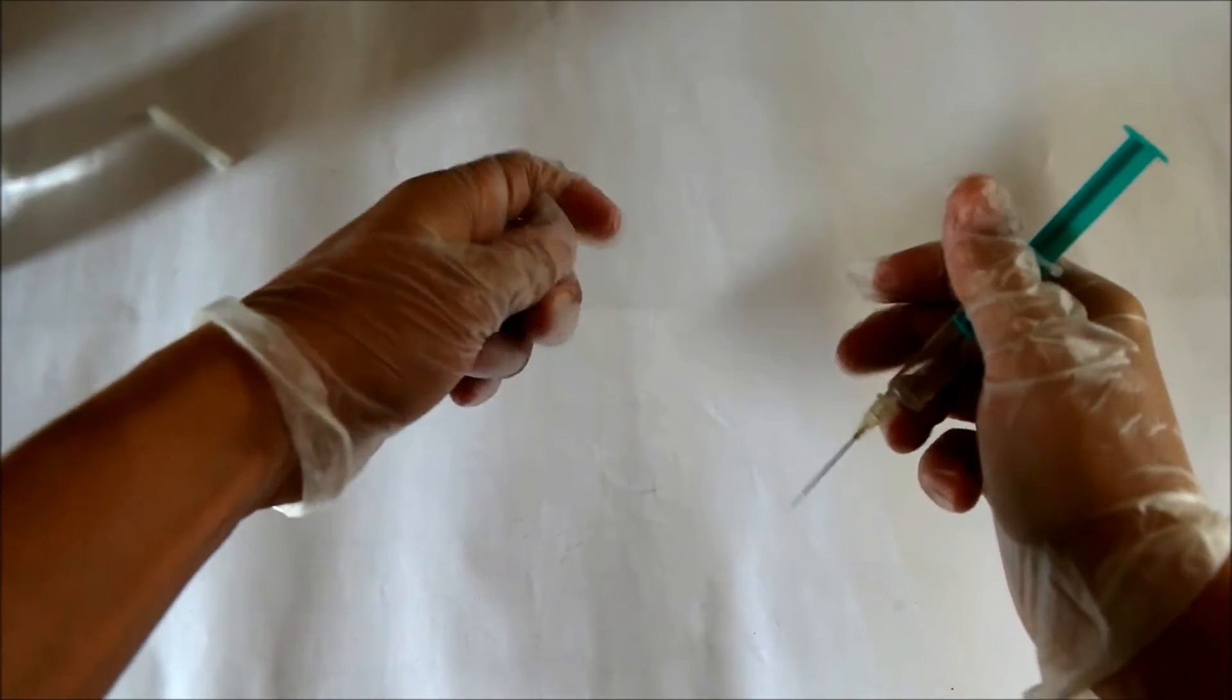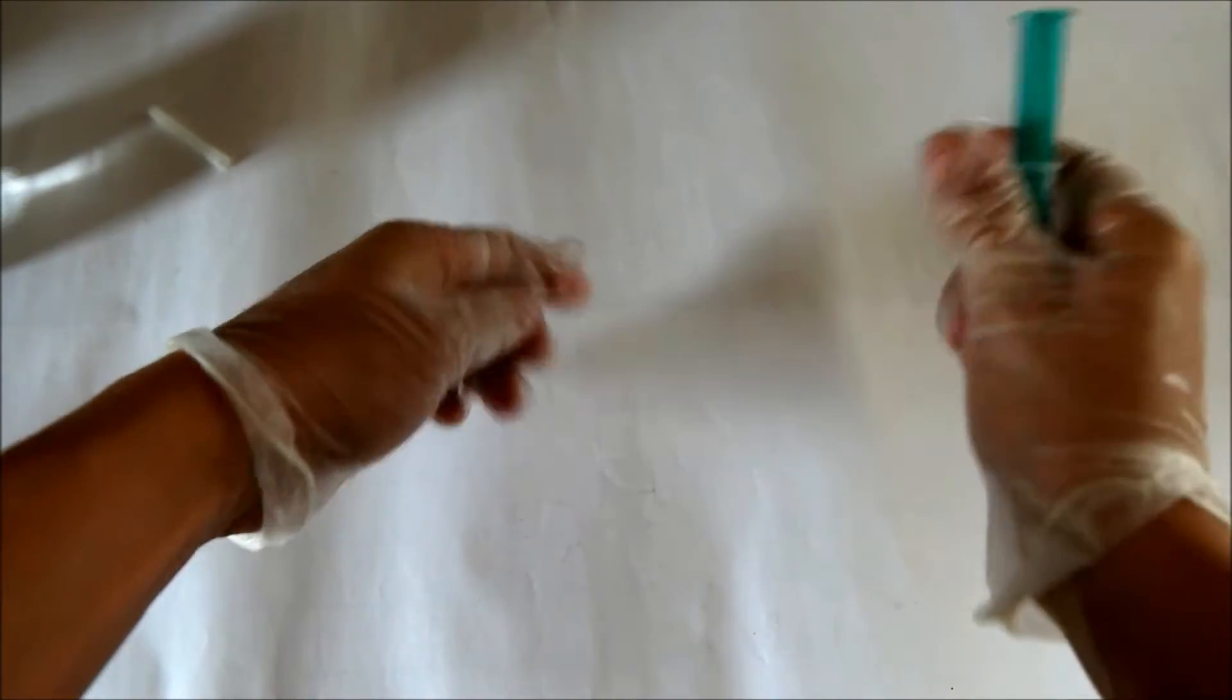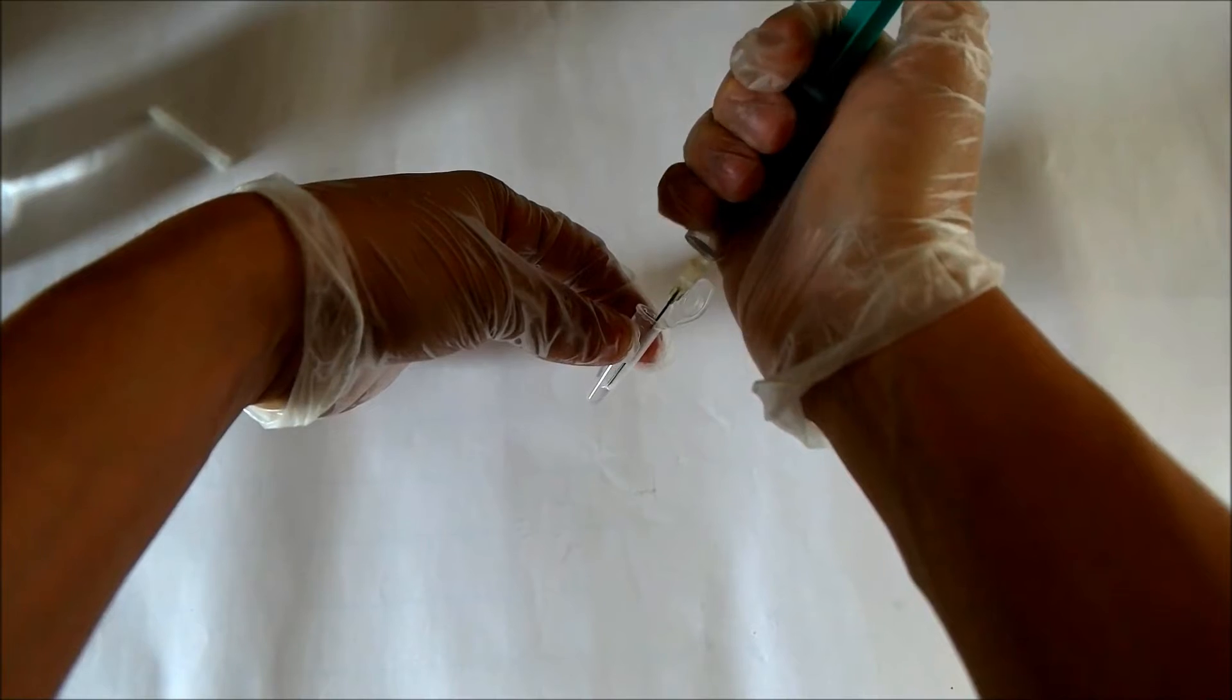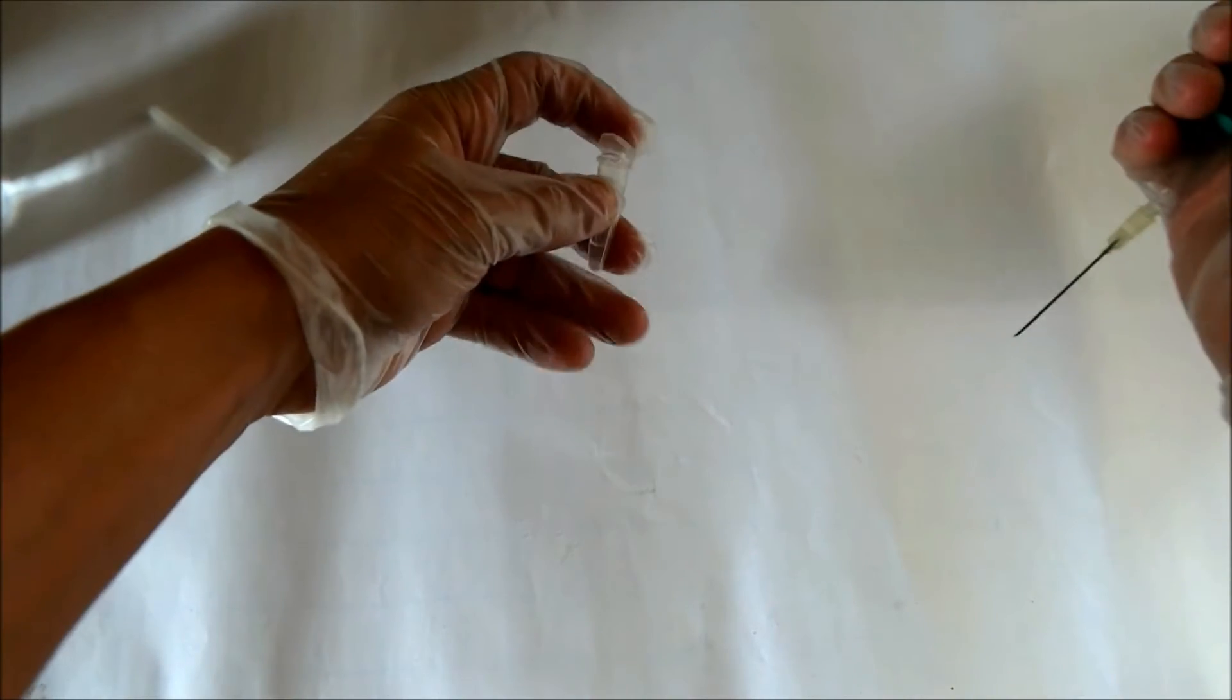Now this is my aseptic eppendorf tube, and I put around 100 microliters in it. It doesn't have to be exact.